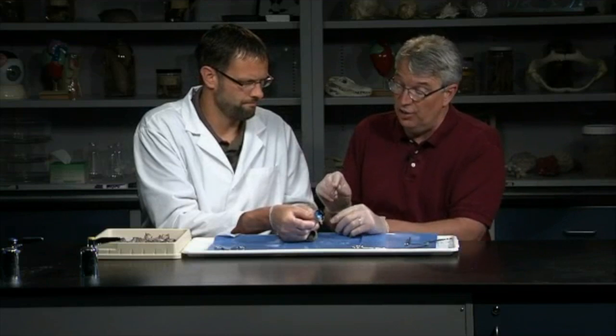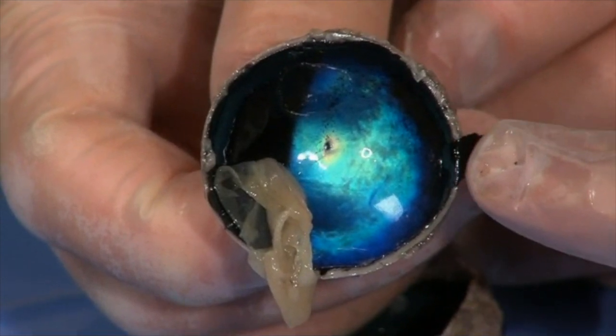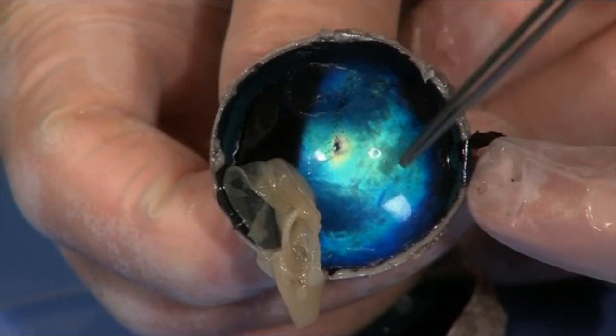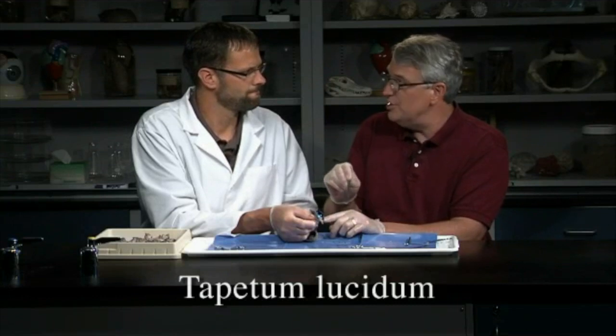Now, interestingly though, and this is one difference between cow eyes and human eyes, cows, cats, and other mammals have a shiny reflective layer in the back of their choroid. It's called the tapetum lucidum, and the tapetum lucidum actually promotes the reflection of light rays, and so these animals have much better vision in low light situations.